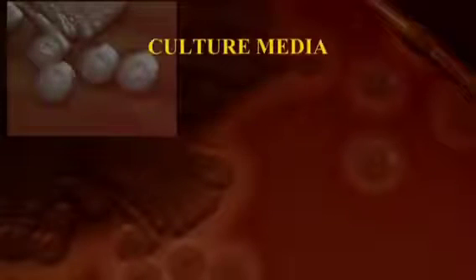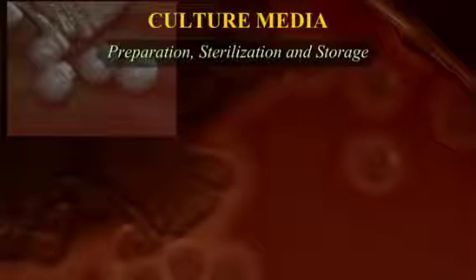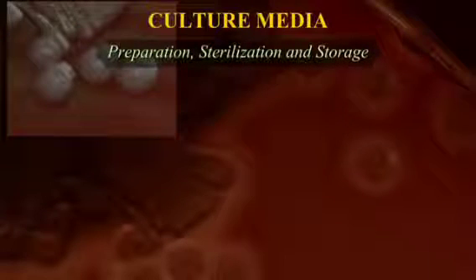Culture Media: Preparation, Sterilization and Storage.